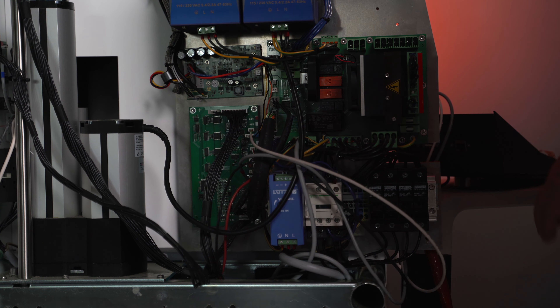Once you have your component replaced on the electronics panel, the next thing we're going to do is close everything back up. Slide your panel back into place. Make sure that your retainer hole is lining up — if you need to pry the guide bar up, go right ahead. You may want to use a smaller driver in order to align that hole to get your screw started. That screw's in place.